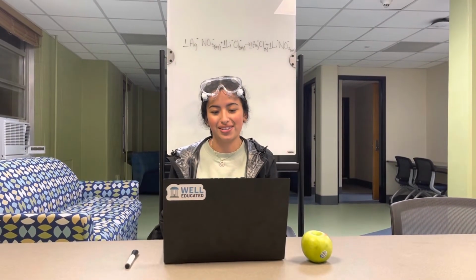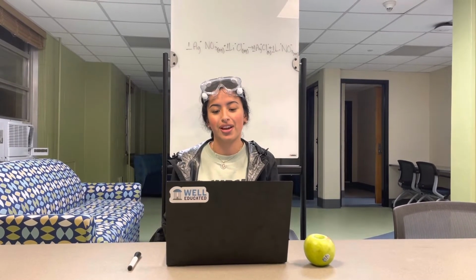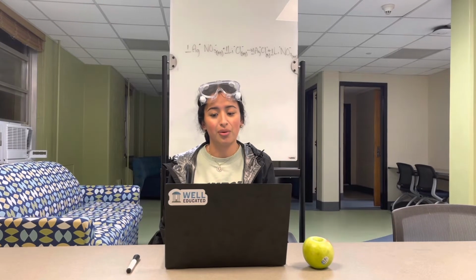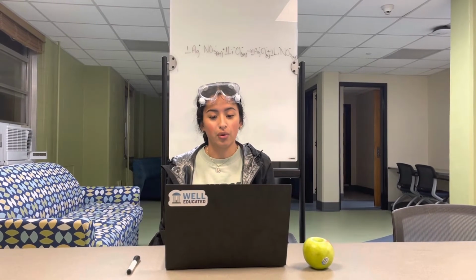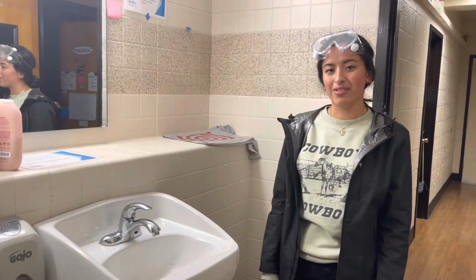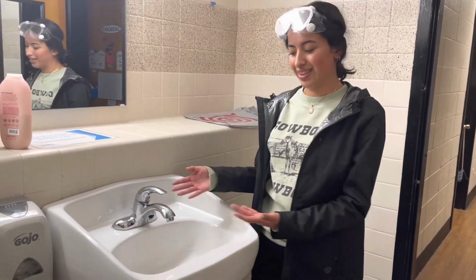Okay, now a titration is a chemical analysis experiment where known quantities of a reactant are added to an unknown concentration of a substance. However, using titrations, we can figure out the unknown concentration. We would find the equivalence point, which is the point in the titration where there is enough titrant of known concentration to react with the unknown concentration. Before you reach your equivalence point, make sure to add small increments of your titrant like this.